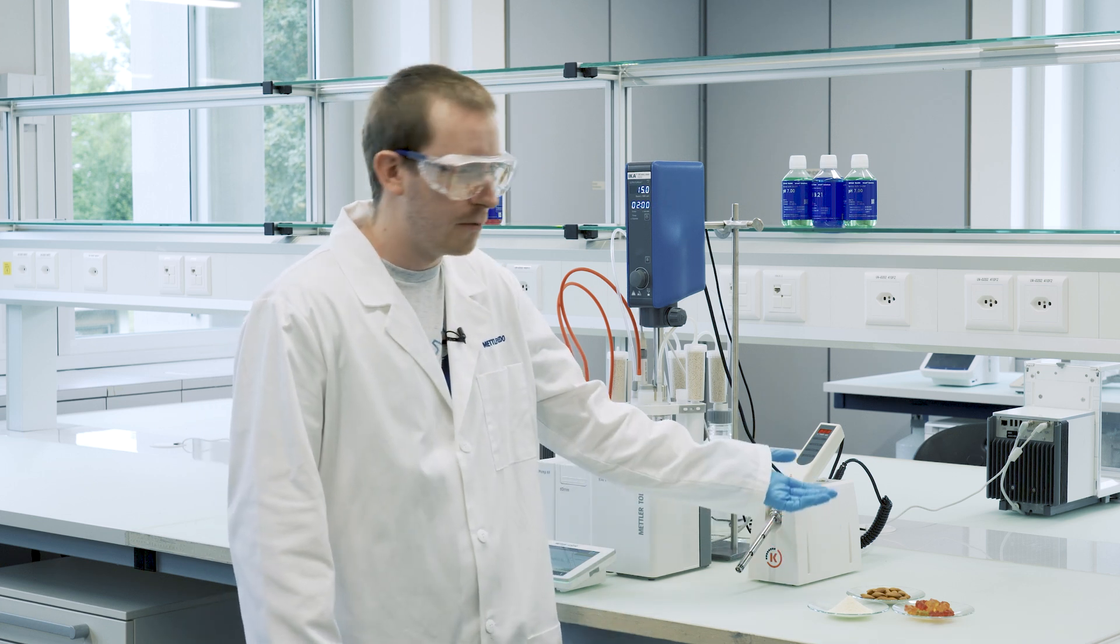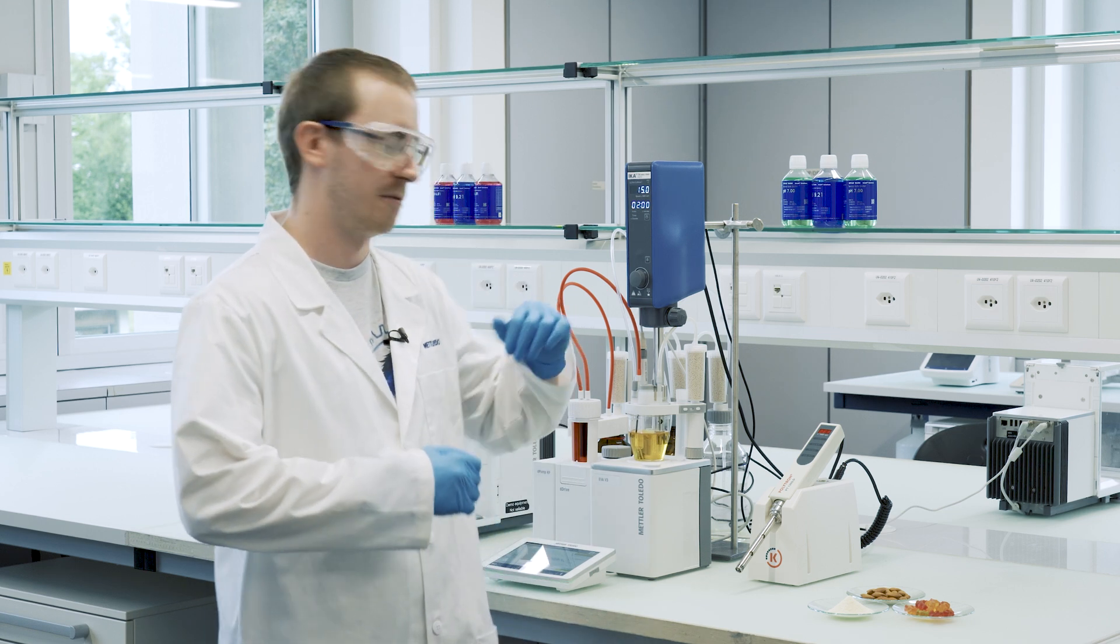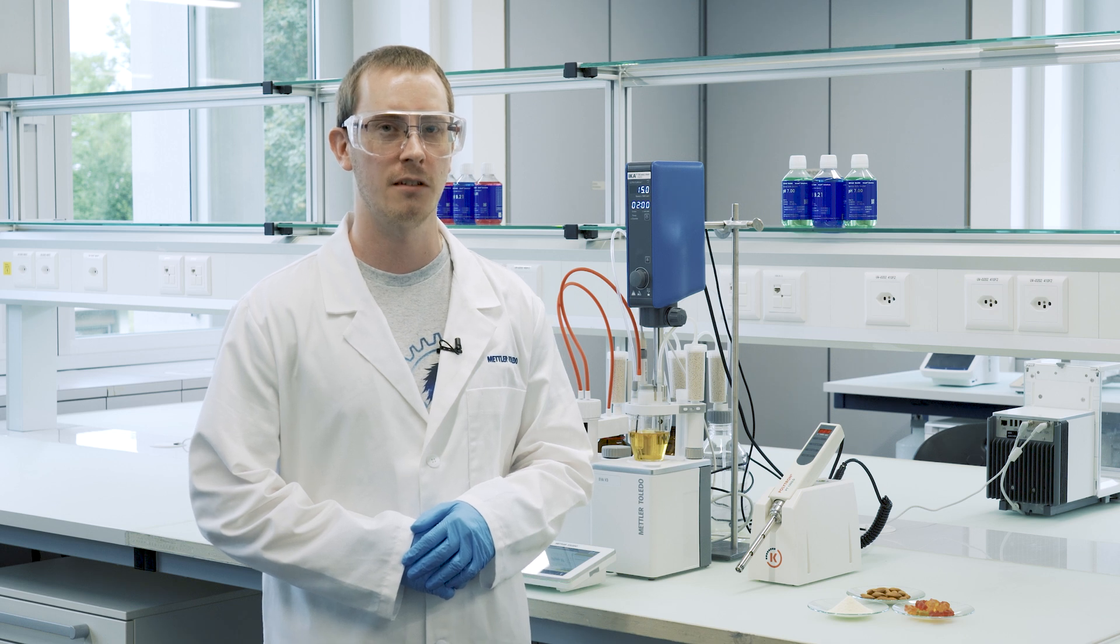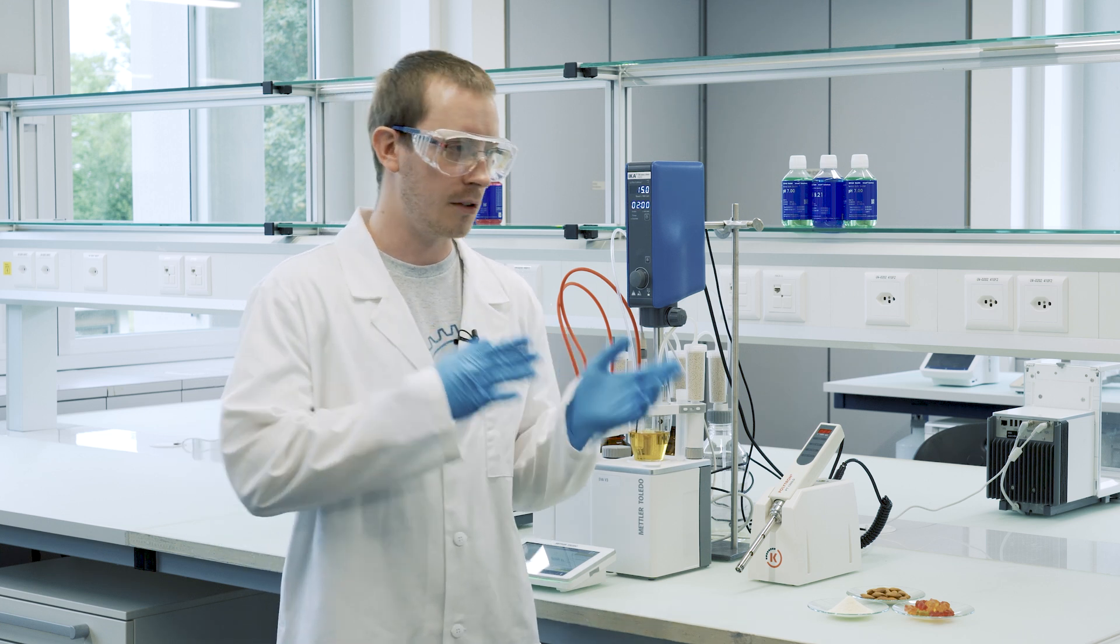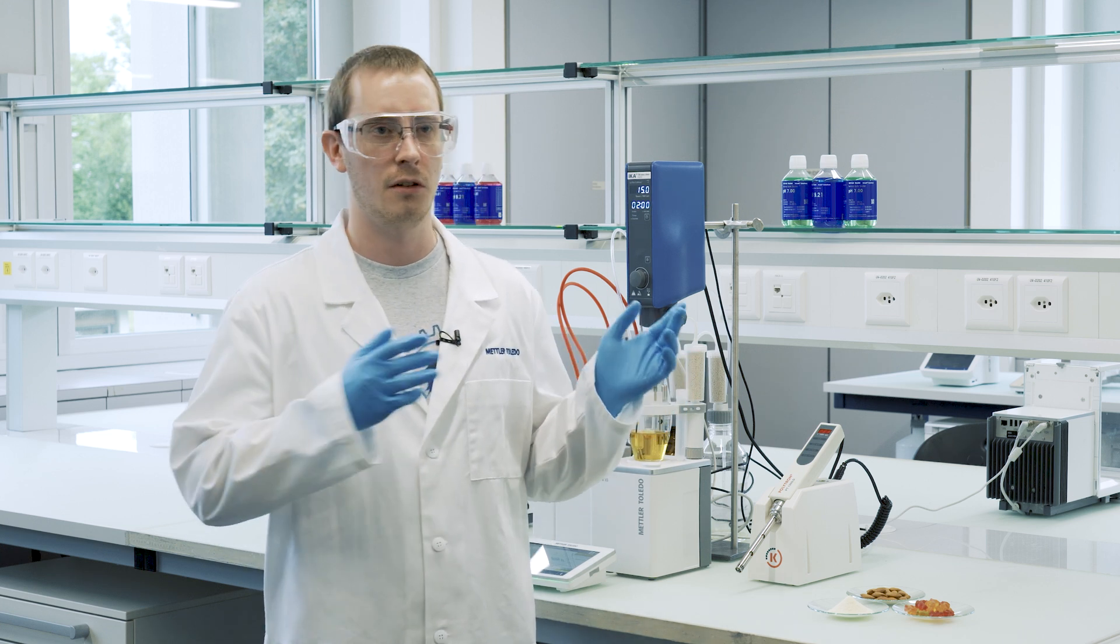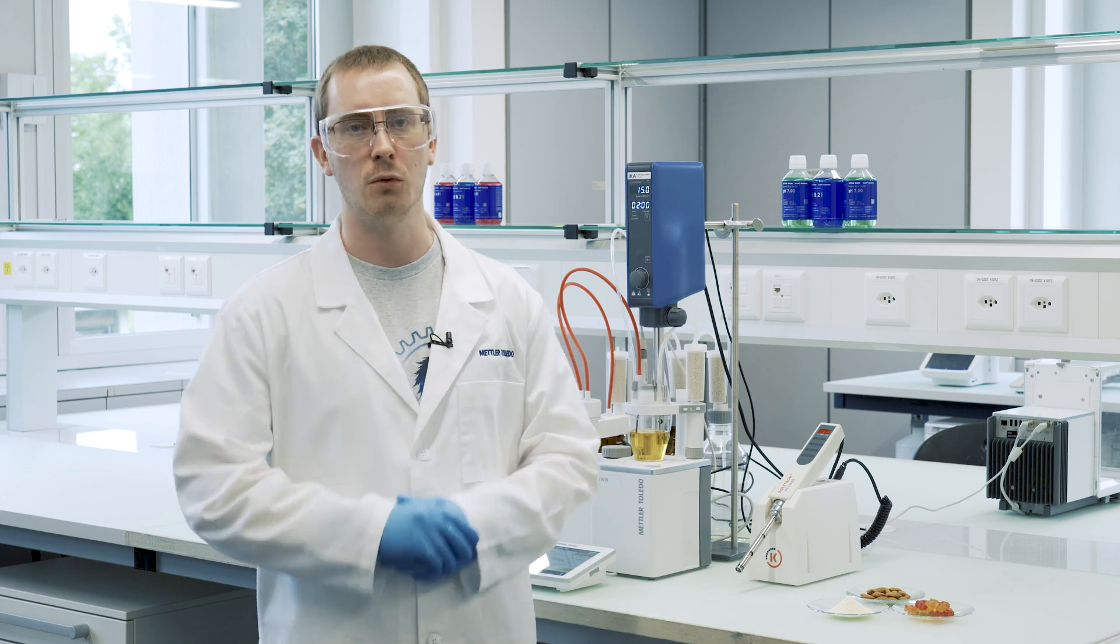The almonds, very obviously if I throw in a whole almond it will never release its water. The homogenizer grinds it down to a fine paste. And finally the gummy bears which we will analyze today. Since they dissolve so slowly, maybe 15 to 20 minutes, the homogenizer brings this time down to less than two minutes.